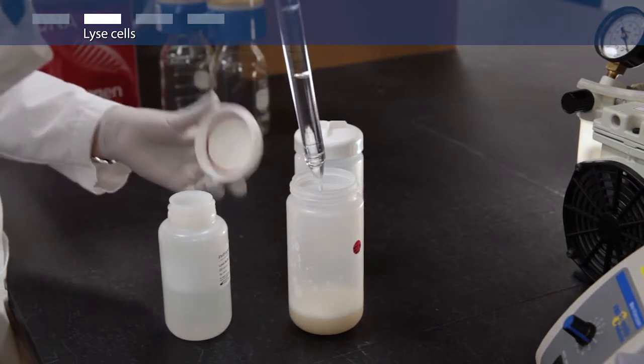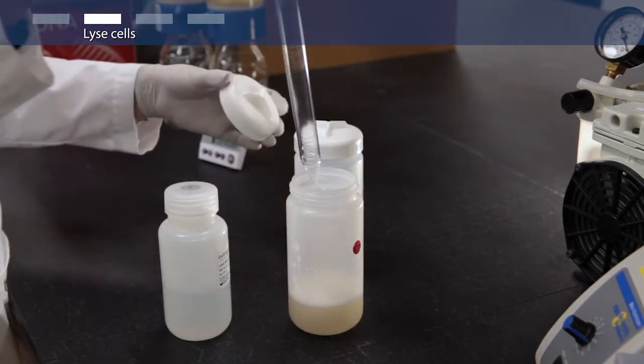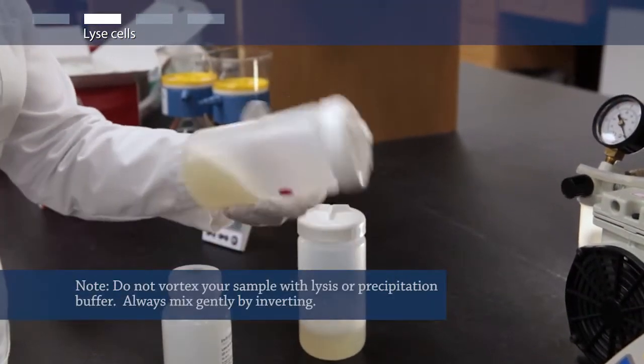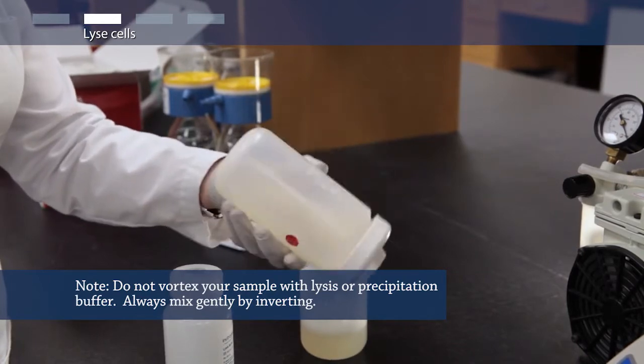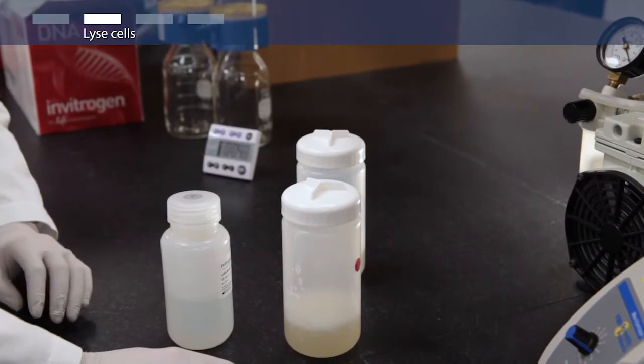Next, add 50 milliliters of lysis buffer. Mix gently by inverting the capped container until the mixture is homogeneous. Incubate at room temperature for five minutes.